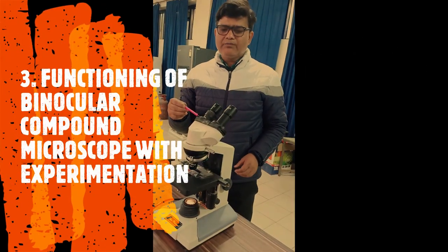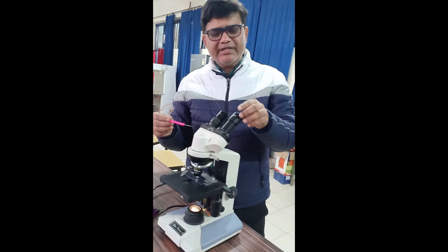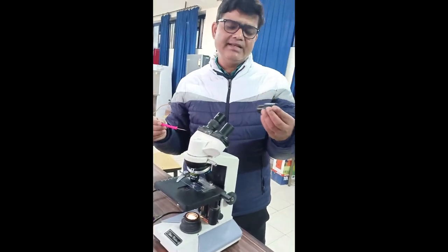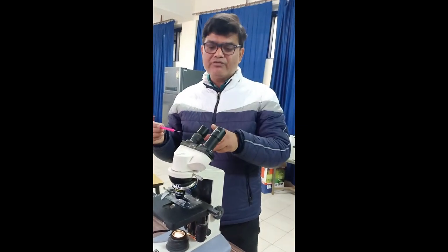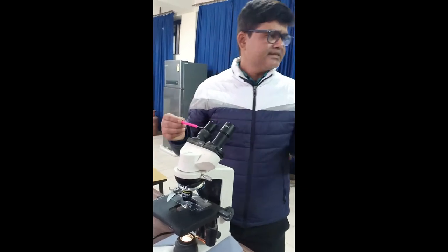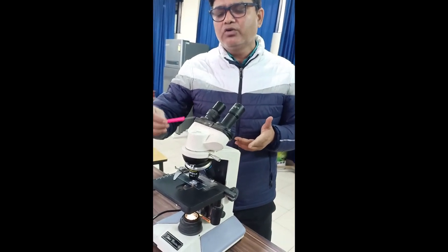Now let us discuss the binocular microscope. It is called binocular because it has two eyepiece lenses, each 10x, where your eye is placed during observation. Let us understand the different parts of this compound binocular microscope.